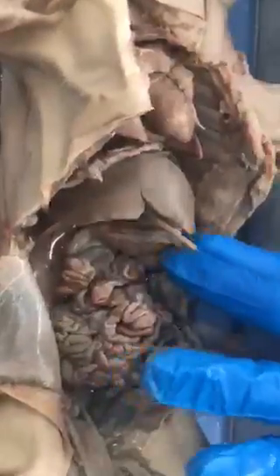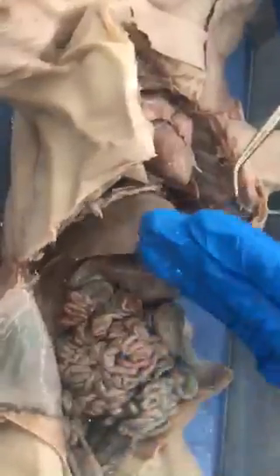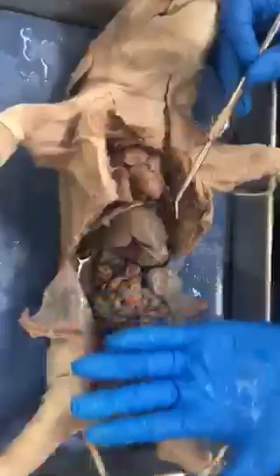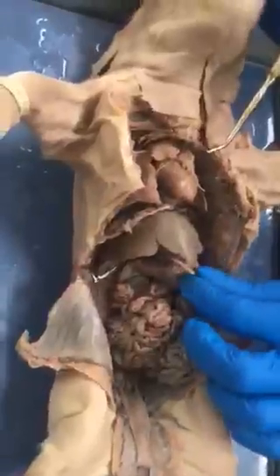But the greater omentum in humans, we deposit adipose tissue into all of our mesenteries, and the greater omentum is this huge apron thing. Omentum means apron. This huge apron thing that hangs down over all the abdominal organs. So we'll learn it in the cadaver, it's huge. In the pig, it's tiny.